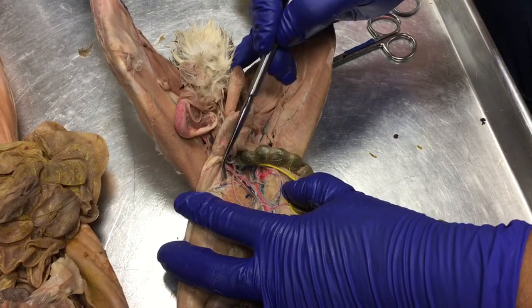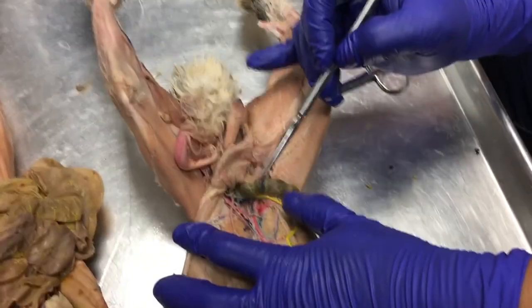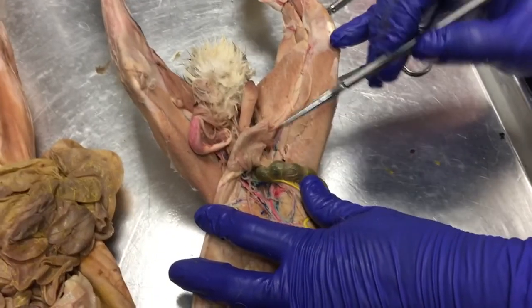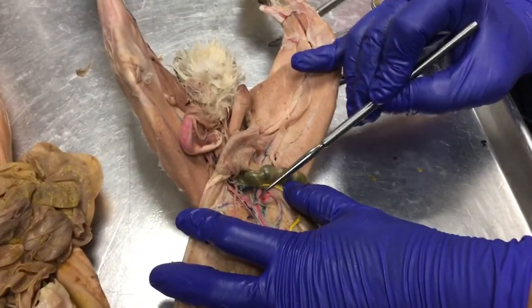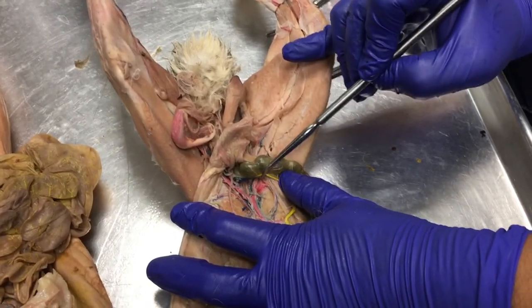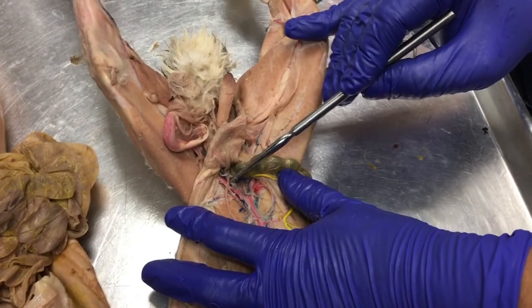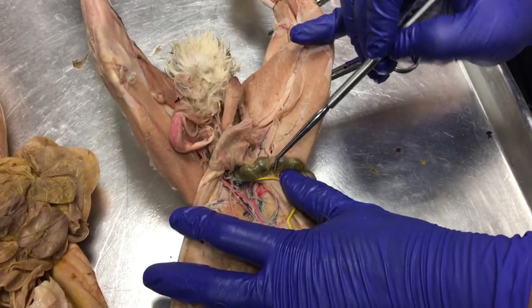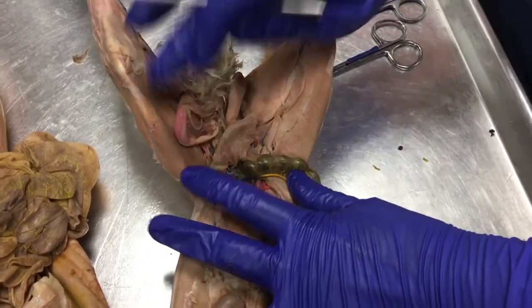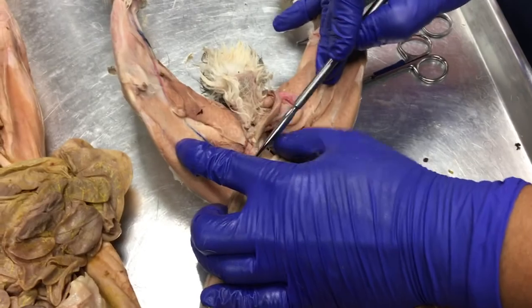This is the iliolumbar artery, ilio referring to where the ilium or the iliac crest of the hip is. So our big V's here that are bringing blood to the legs are our left and right external iliac arteries. The external iliac arteries actually continue out onto the leg right here.